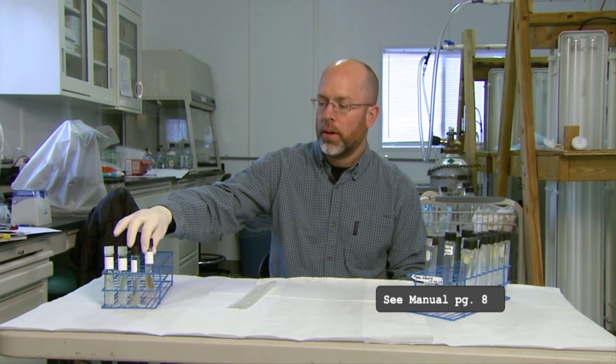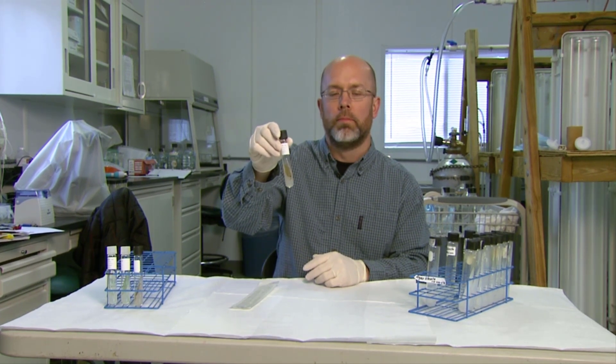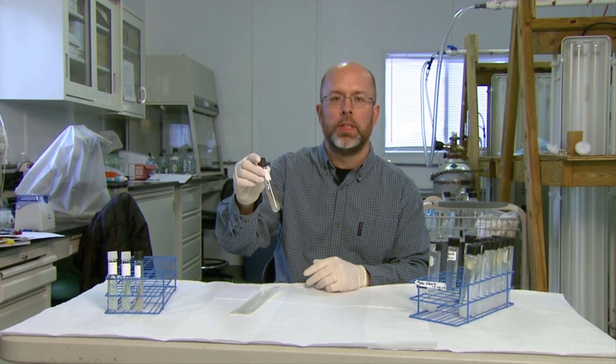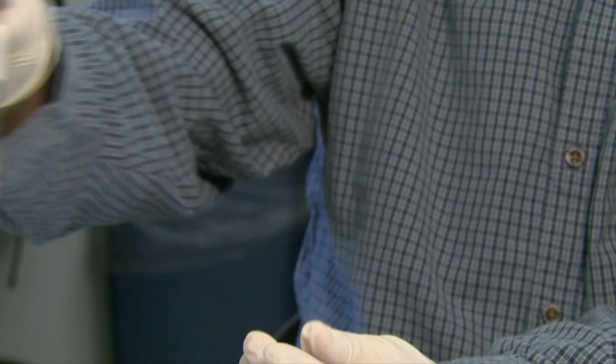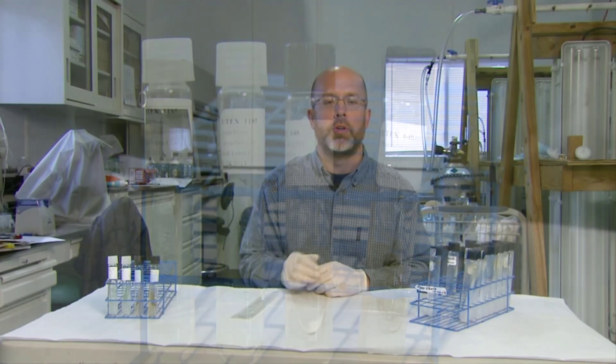In this segment we're going to talk about backing up slant cultures. The slant cultures are the first step in the algae culture process. These particular slants — you can buy stock cultures from the University of Texas in a whole variety of species, depending on what species you want for your mussel culture. The problem is the slants have nutrients in them and at some point the nutrients are going to be used up by the algae. So it's important that on a periodic basis you transfer the algae from one slant to another so that it has fresh media to grow, and that's what I'm going to show you how to do right now.